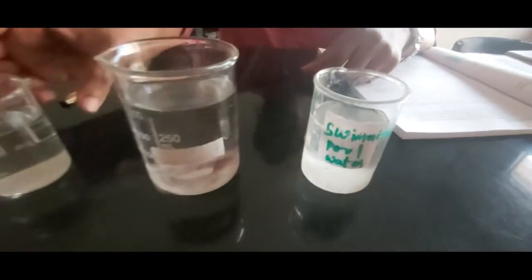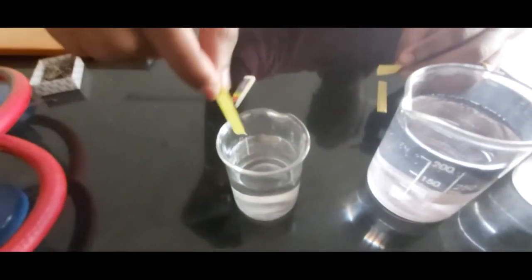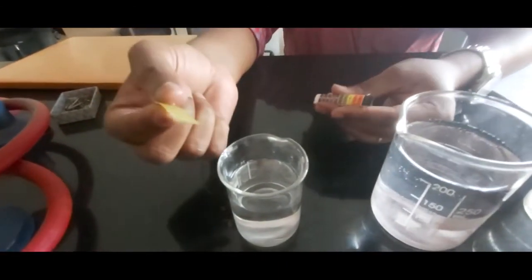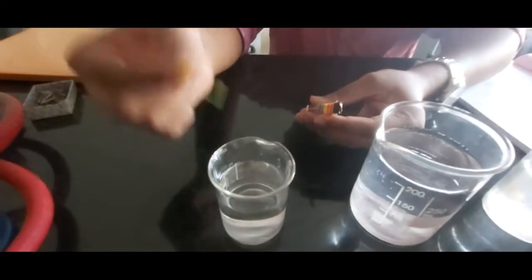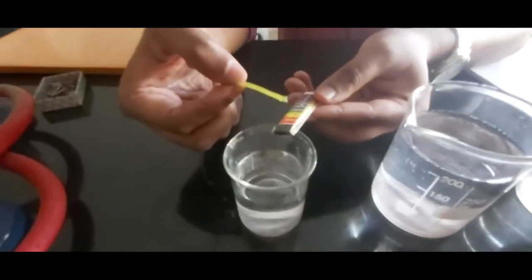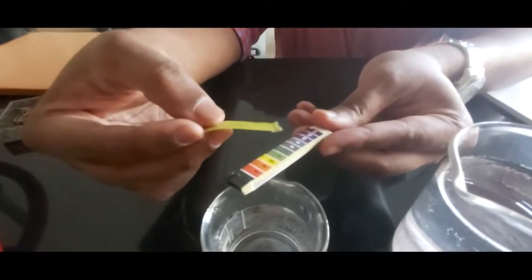Now how are we supposed to perform this experiment? pH papers will be given to each and every student, and the students are supposed to dip the pH paper in the given solutions. The first one is the distilled water. Now whatever color appears on the pH paper, just wave off the extra water, and this color you can match with the standard readings given on the pH paper's cover.